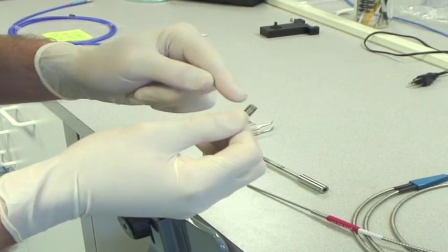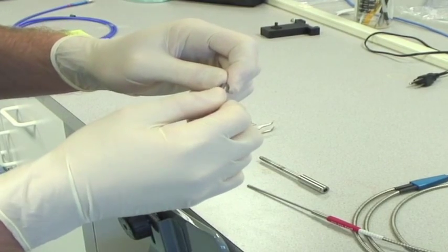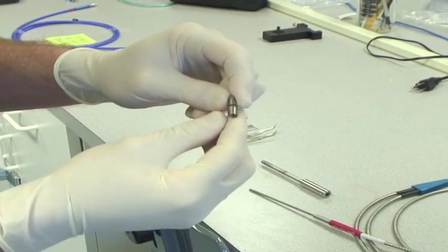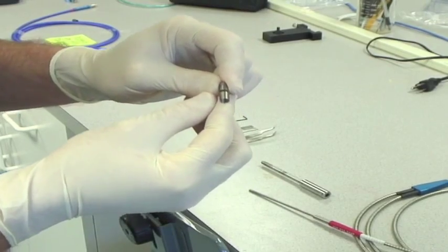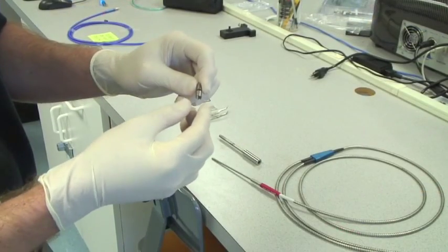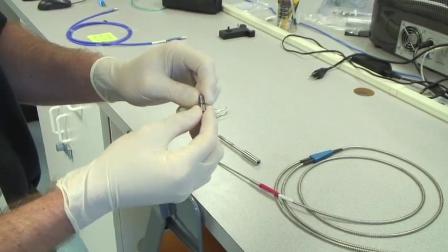Once upon a time these tops of the mirrors screwed off and you could also put a patch on there, but the change has been made to epoxy these on, so you can no longer fix a second patch on there although in the manual it mentions adding a second patch. That actually can't be done anymore.